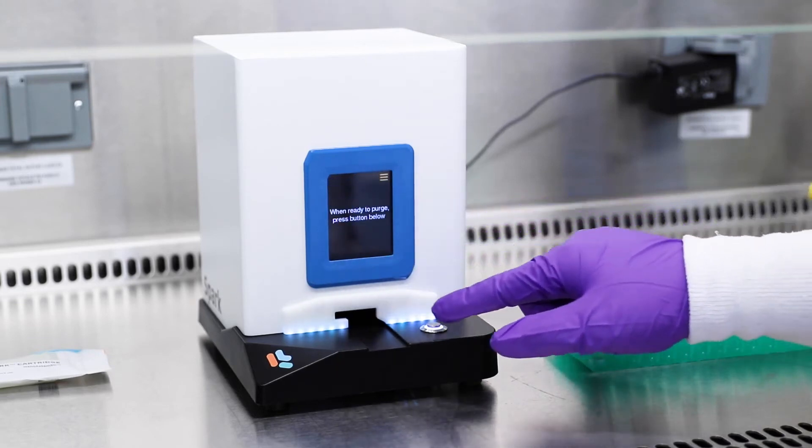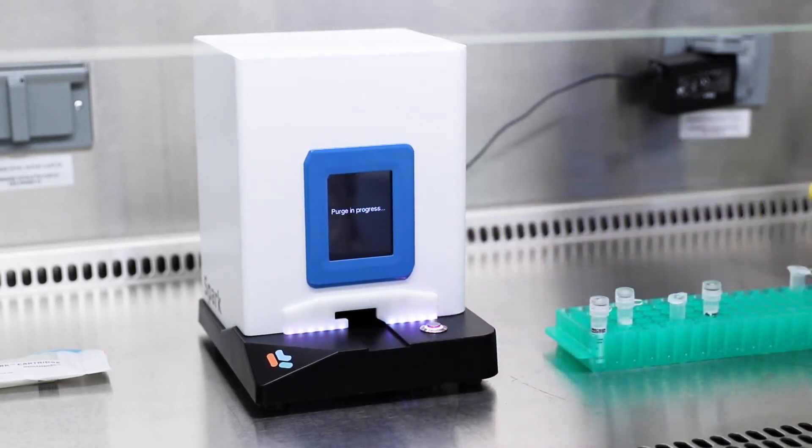Finally, the Purge Mode will allow the user to purge the internal system with ambient air. This is an important step when the Spark is first installed in an aseptic environment such as a biosafety cabinet.